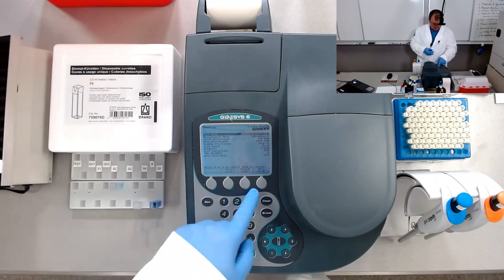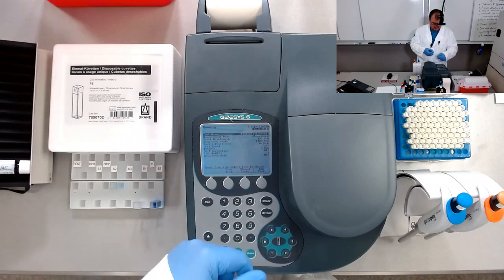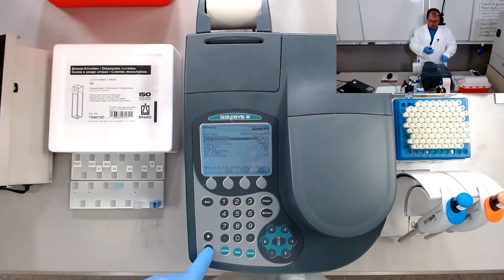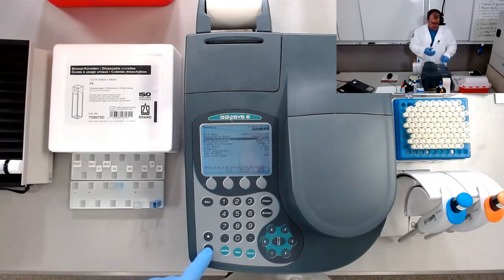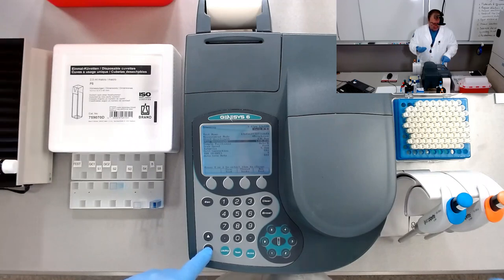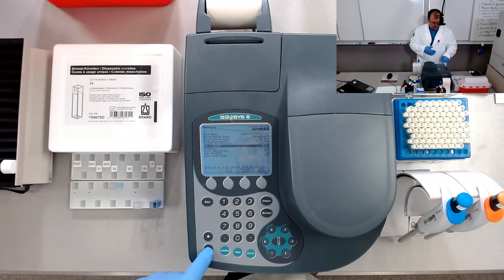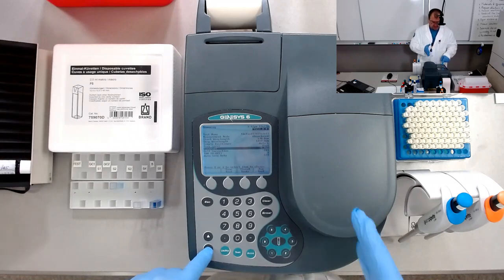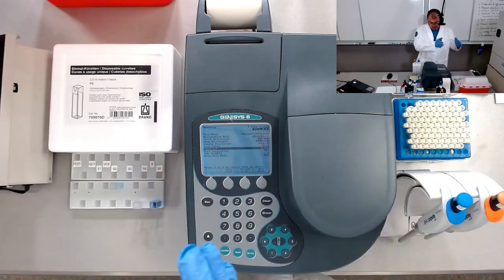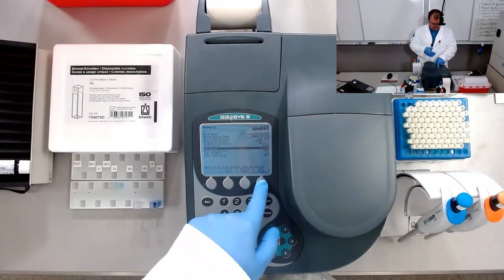The test name is the one that we saved before, in absorbance mode, start wavelength 190 nanometers, deep in UVC, stop wavelength 1100 nanometers in infrared, sample position 6, auto 6, which is the carousel, and the scan speed fast, and the interval 5 nanometers. So the measurements will be taken at 5 nanometers from 190 nanometers to 1100 nanometers. So let's run the test.